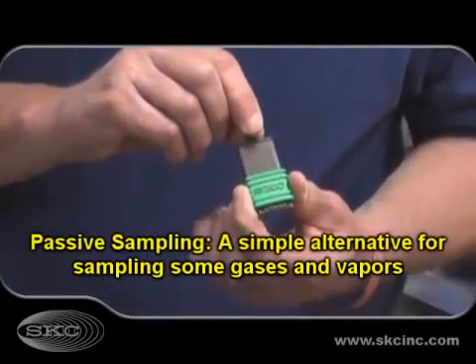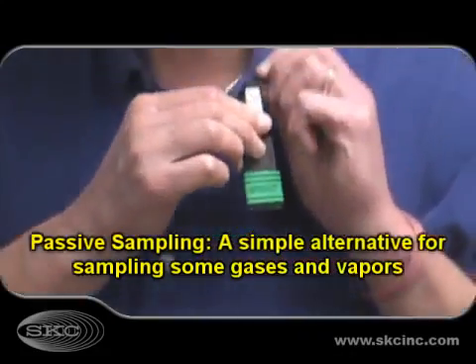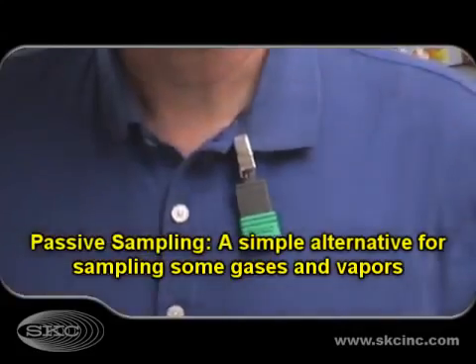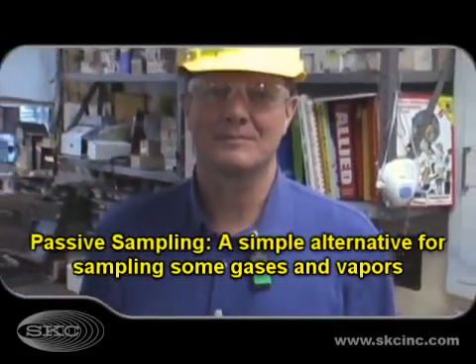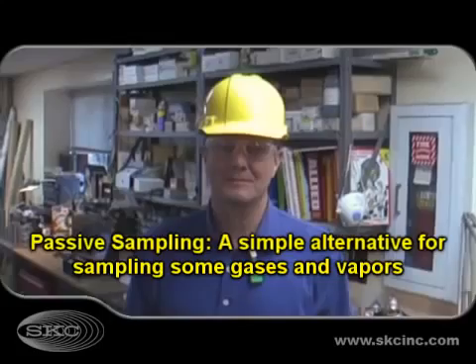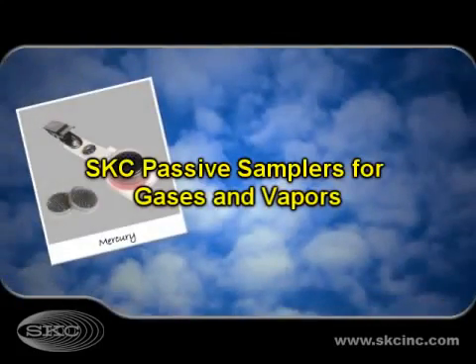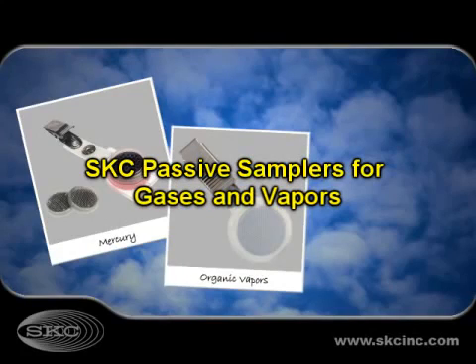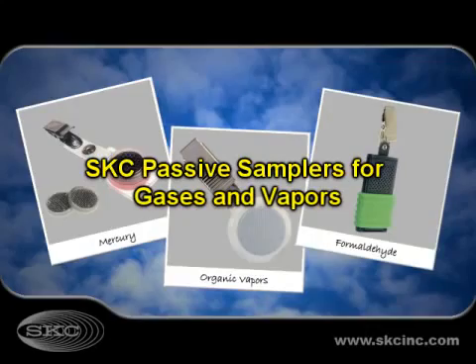Passive sampling is a simple alternative for sampling some gases and vapors because a pump is not required. The worker simply wears a small badge-like sampler that collects airborne chemicals by diffusion. SKC provides passive samplers that have been scientifically validated to ensure reliable sampling of target compounds.